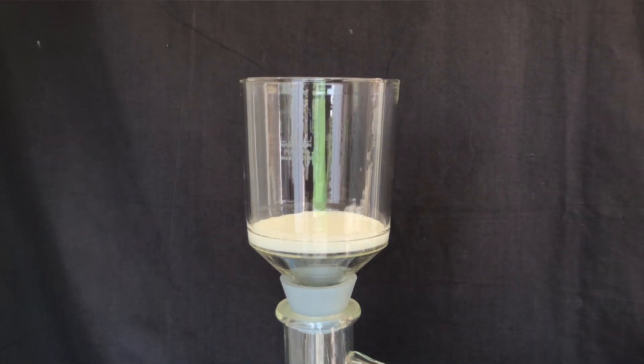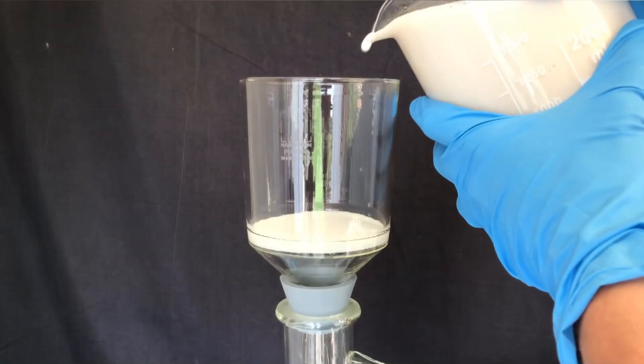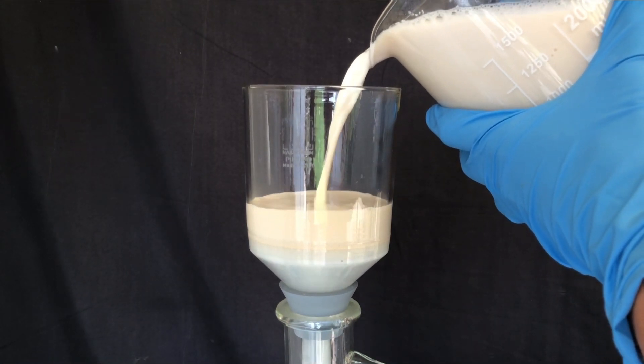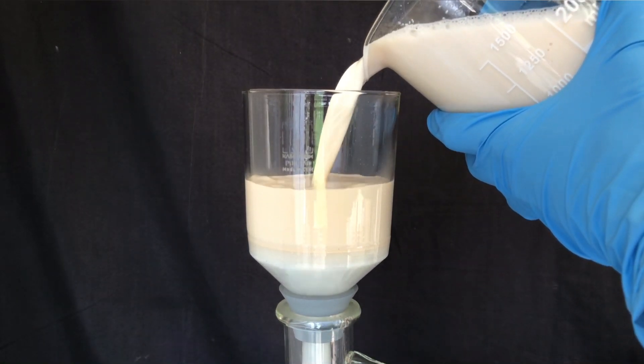Fortunately, I now have a big vacuum filtration setup, so we don't have to work with the 250 milliliter one. All of the stuff was put into this huge filtration funnel and we vacuum filtered.